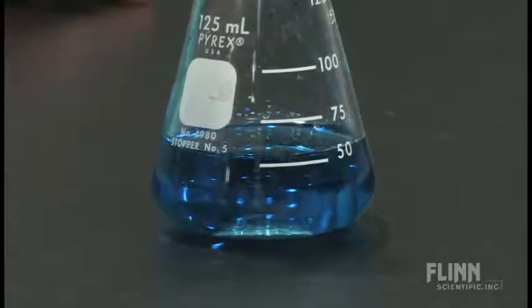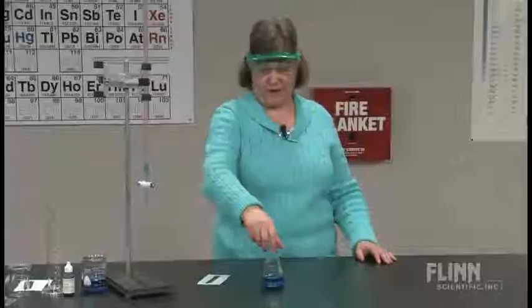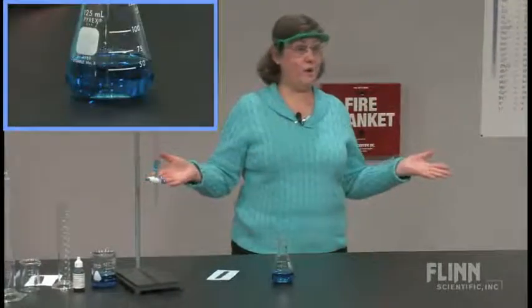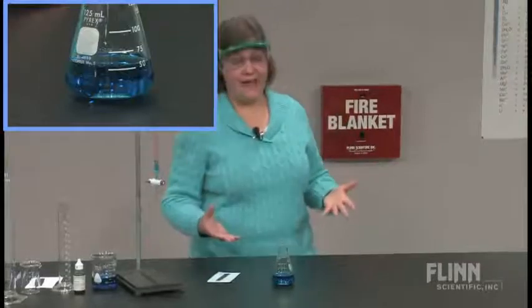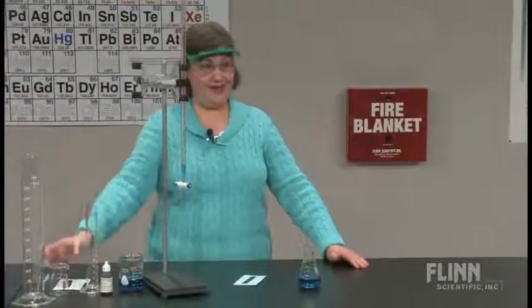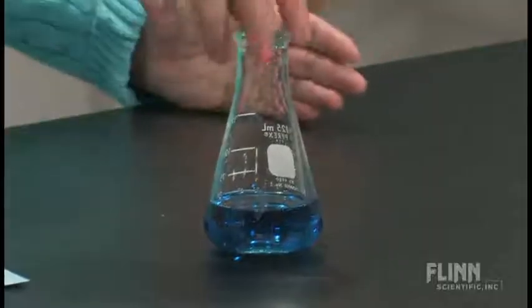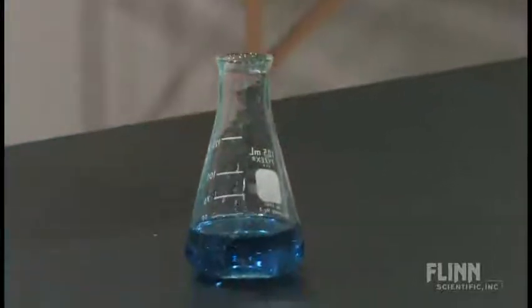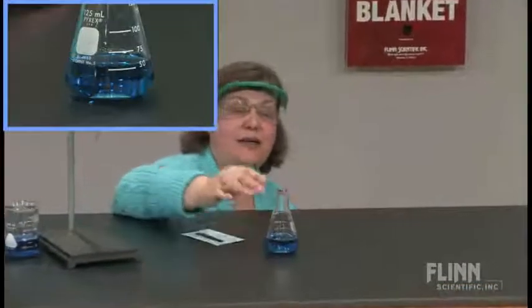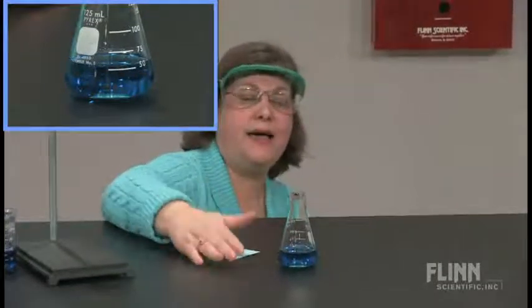And I think you've probably got a good shot of what that level is reading. And let's turn it around. Now here, what are our markings? Our markings were 50, 75, 100, and there are no minor markings whatsoever. And not only that, but all of these pieces of glassware had a uniform diameter, cylinder size. Well, this one obviously doesn't, so who knows what I've got, but let's go ahead and give it a shot. It looks like it's above the 50, clearly below the 75. I have no idea, but there's more down here, since it's wider at the bottom, it gets narrower at the top.